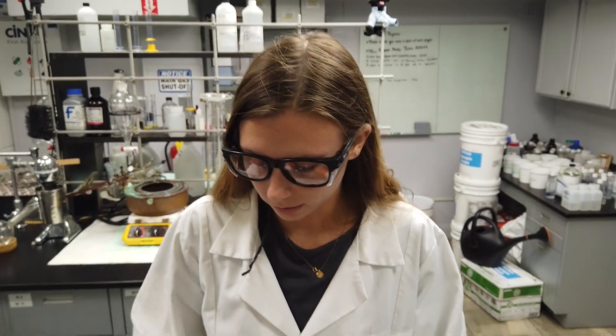Once the Acid Sulphate Crystals are dissolved, add Potassium Permanganate dropwise while swirling. Count the number of drops until the sample turns a faint but permanent pink. The color should persist for at least 15 seconds.